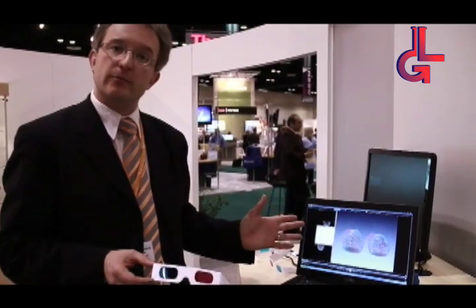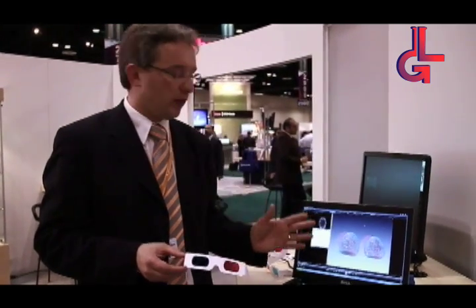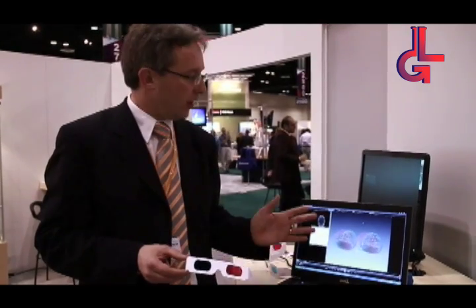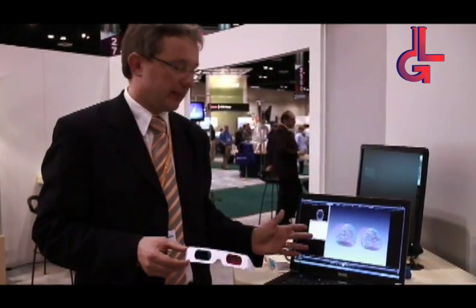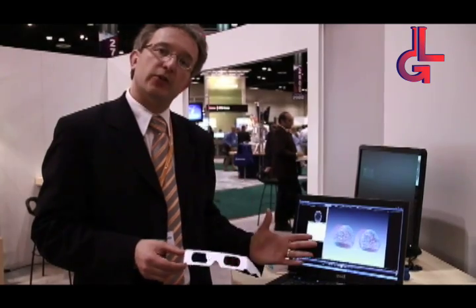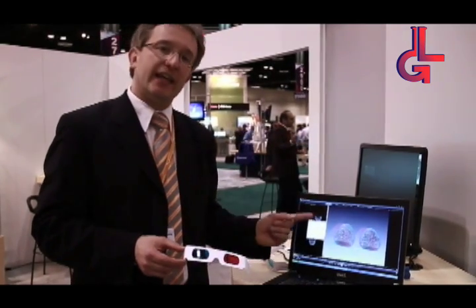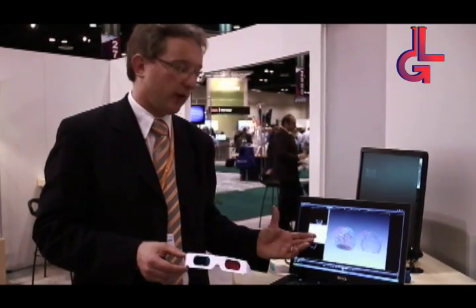The example that I am showing you here is a computed tomography analysis of two Viagra tablets. One of them is an original one and one is a counterfeit. With computed tomography we can see inside these tablets without destroying them.